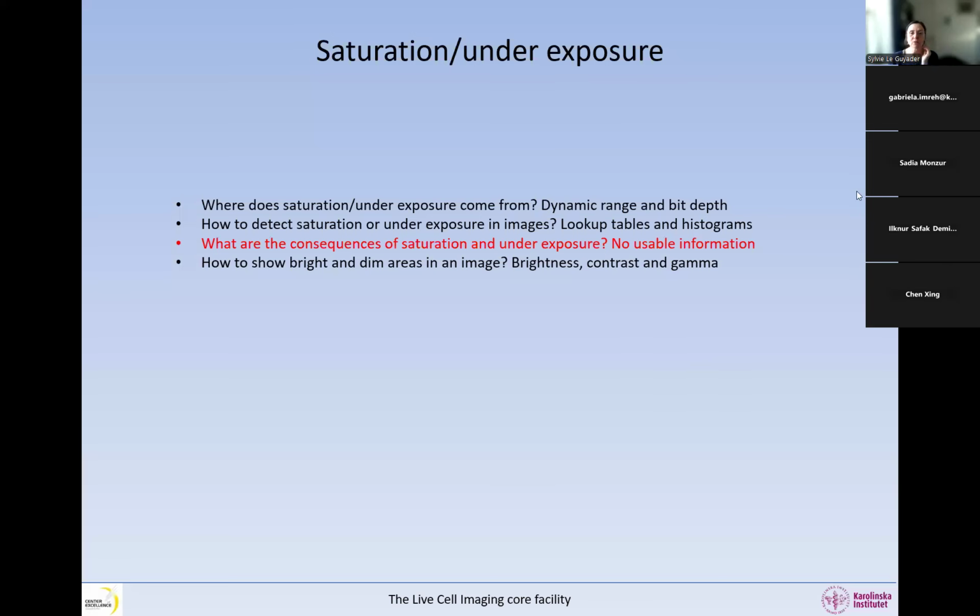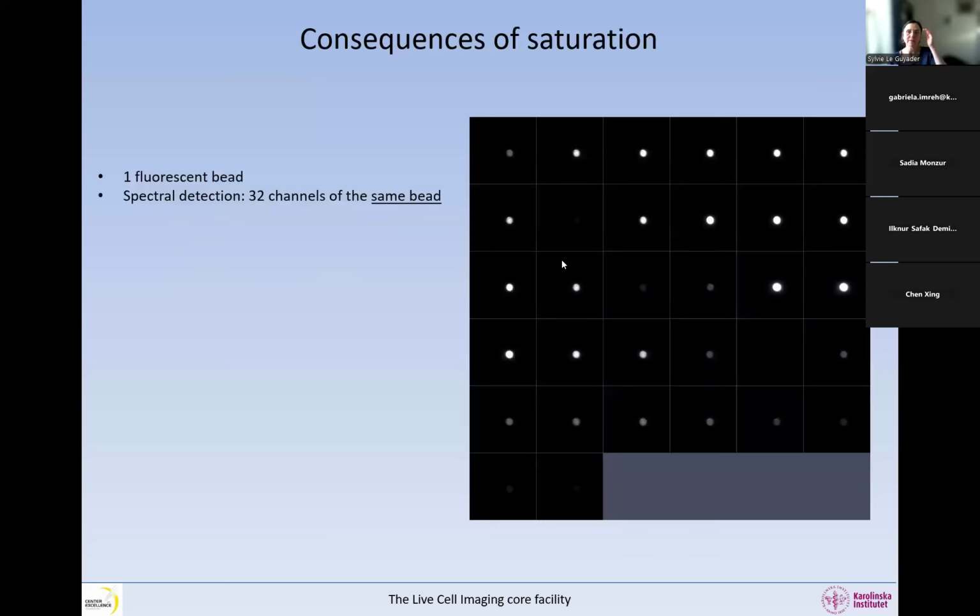What are the consequences of saturation and underexposure in our images, where we have no usable information? So let's have a look at that. What does that mean? So, the consequences of saturation. In this image, we're using a spectral detector, and we'll see later today what that means. A spectral detector, some of them have up to 34 channels, but in this case we have 32 channels.